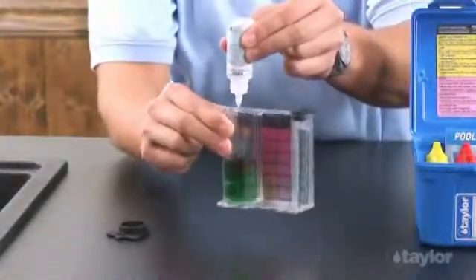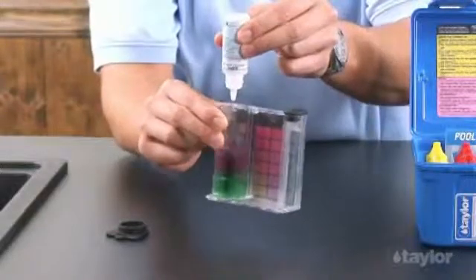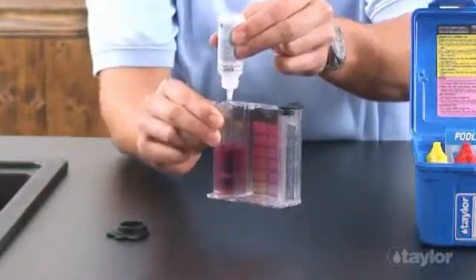Multiply the number of drops used by 10. Record the result as parts per million calcium carbonate.